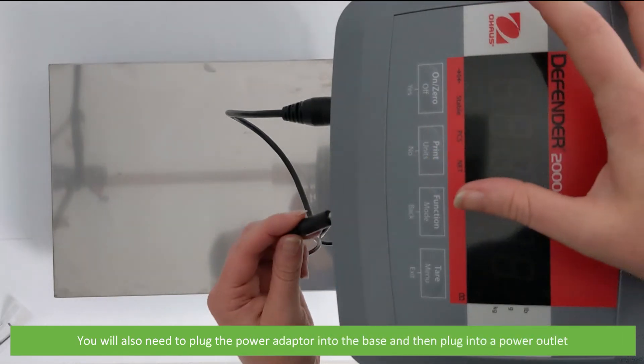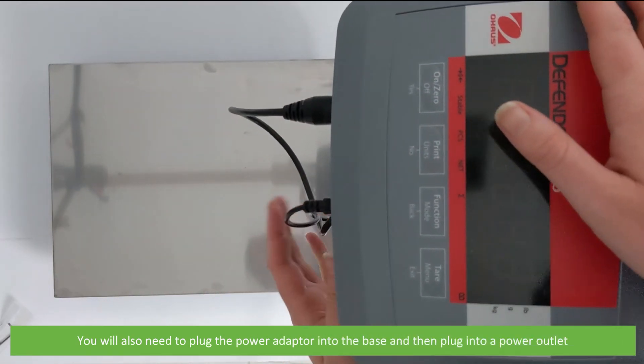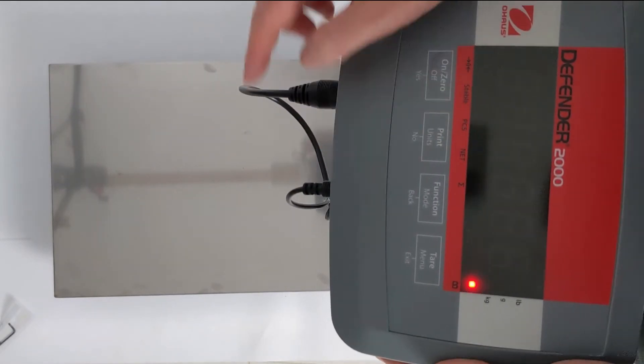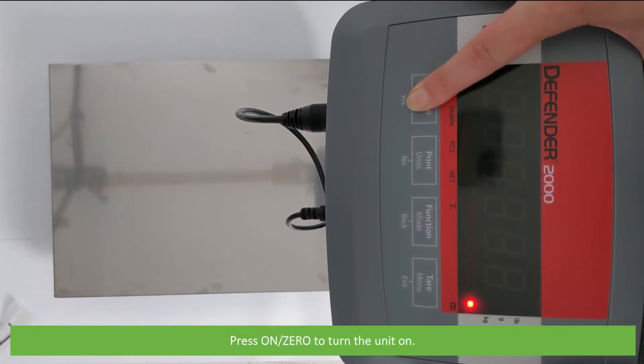You will also need to plug the power adapter in to the base, then plug into a power outlet. Press on slash zero to turn the unit on.